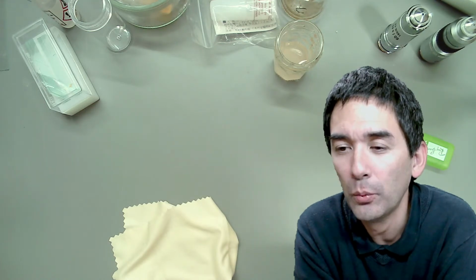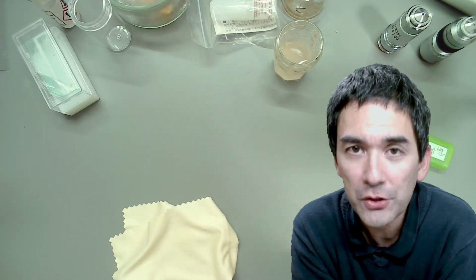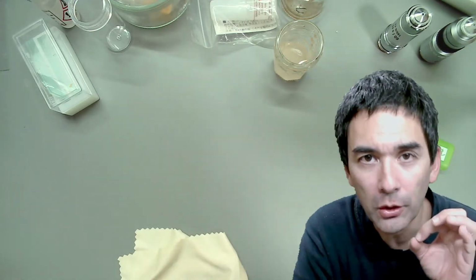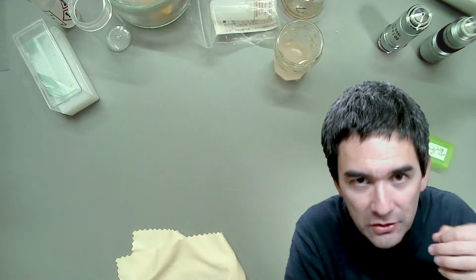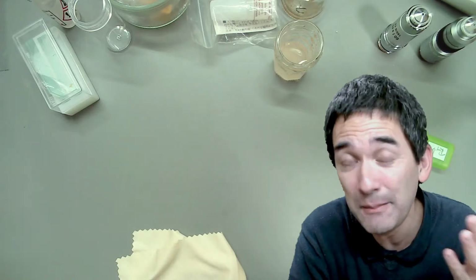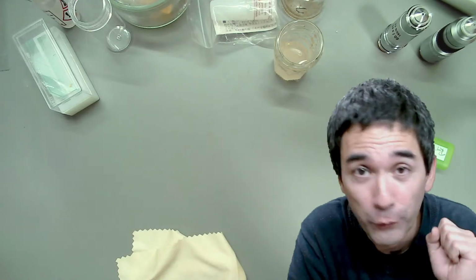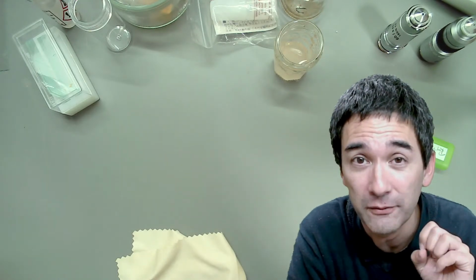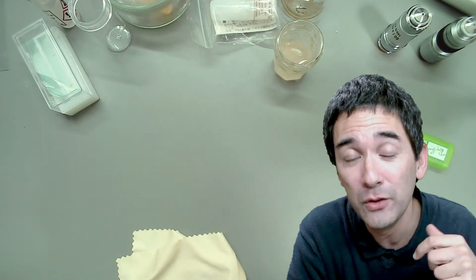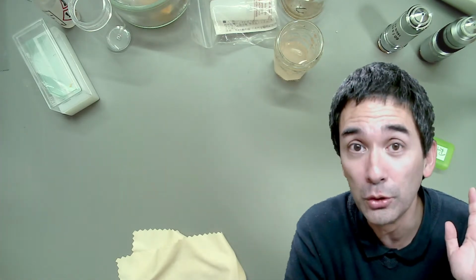Is dark field possible with oil? I will tell you probably not, for the following reason. First of all, dark field microscopy can be done, for those of you who don't know this, by putting a small dark field filter, also a homemade one, into the filter holder. Dark field microscopy works for magnifications maybe up to, if it's good, around a 40 times objective. This is already stretching it. It's becoming already very dark. And if you want to go up yet higher, then it's going to be simply too dark.